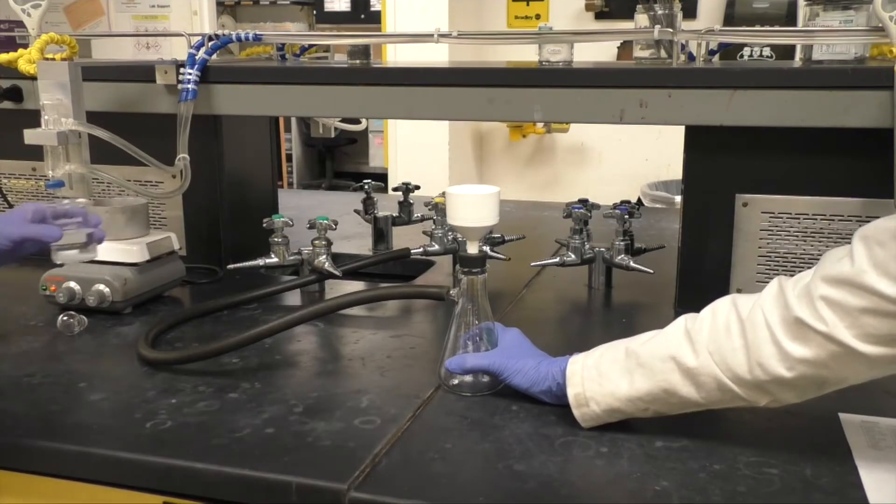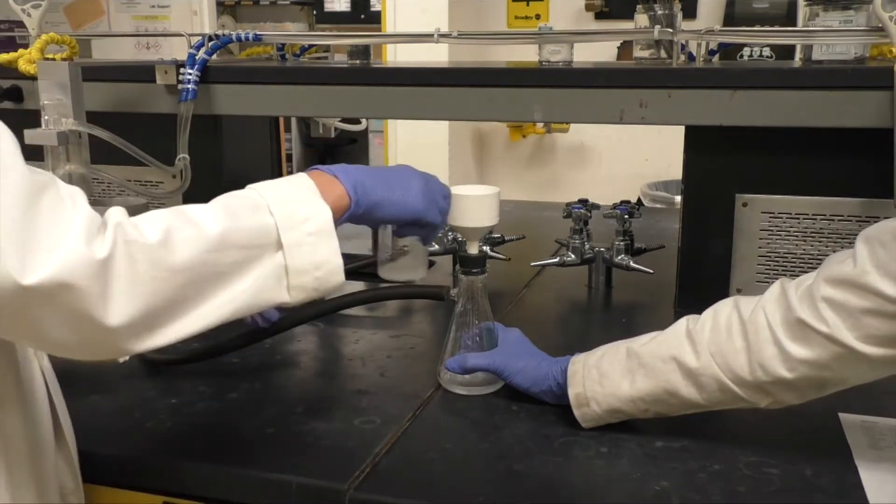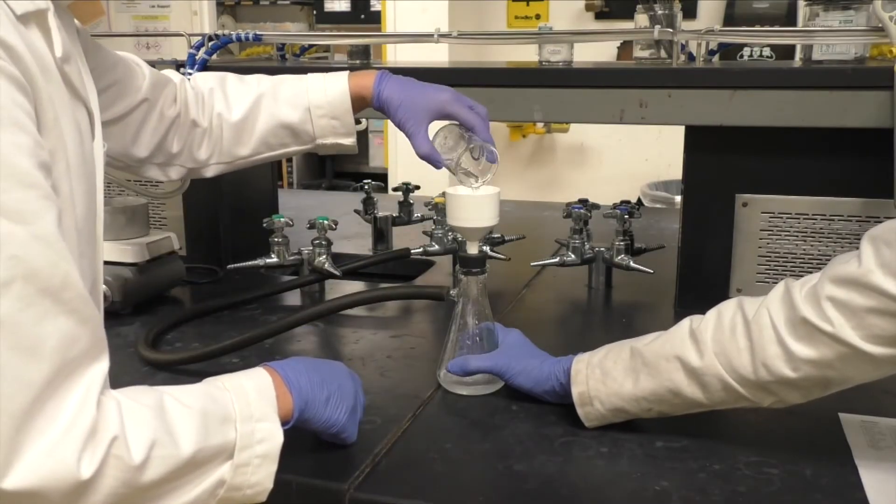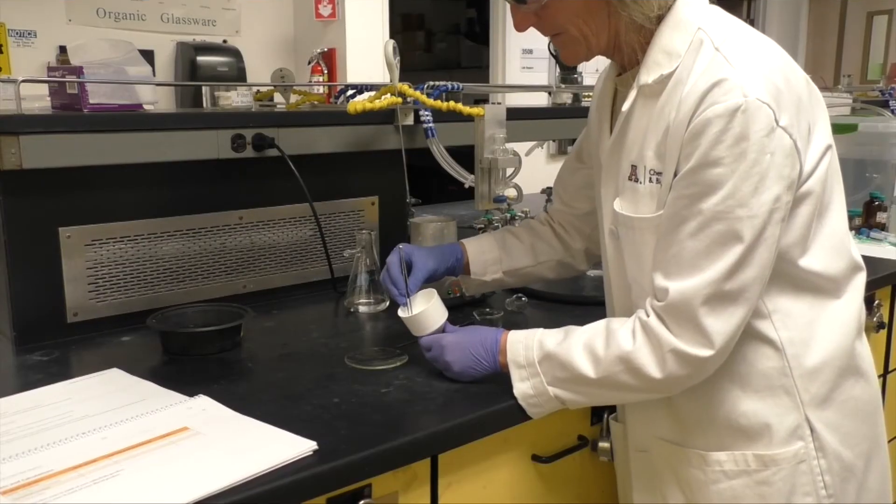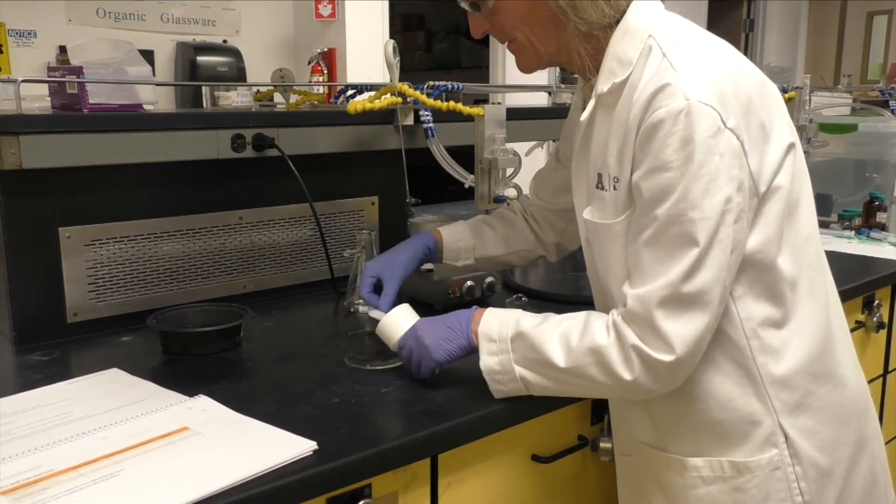Filter your product, keeping the vacuum going for about 2 minutes until it is dry. Weigh the product and record the weight. Further analyze the product as directed by your instructor.